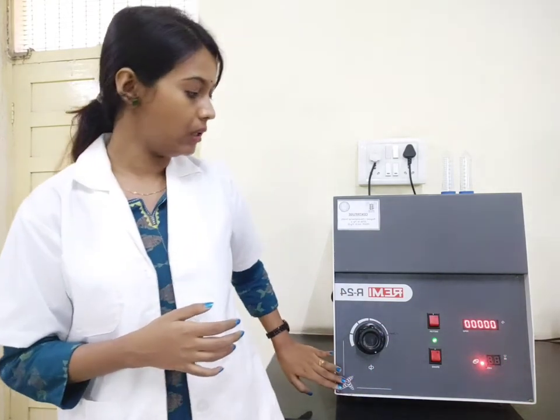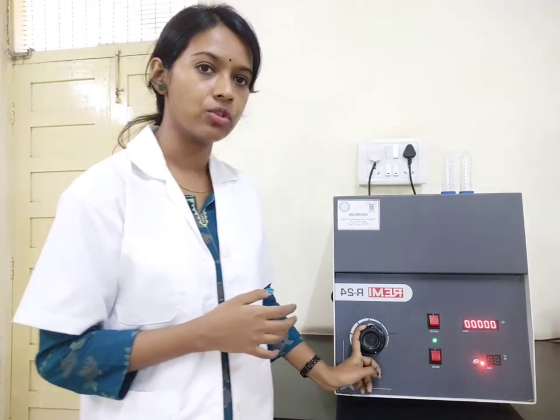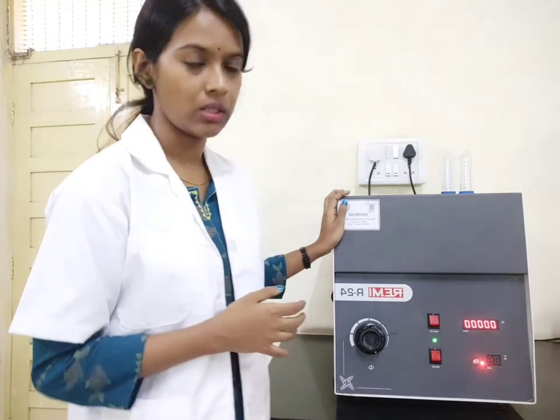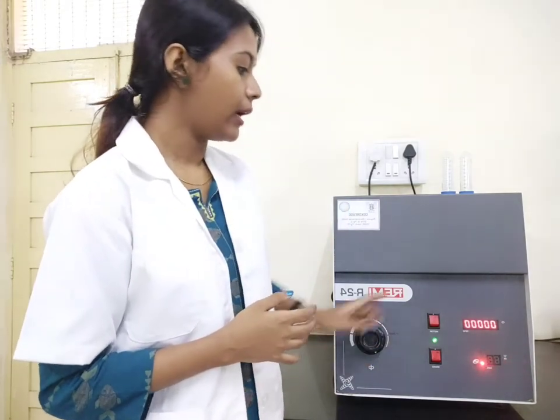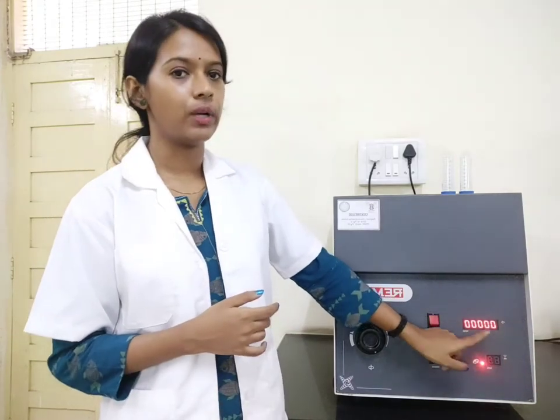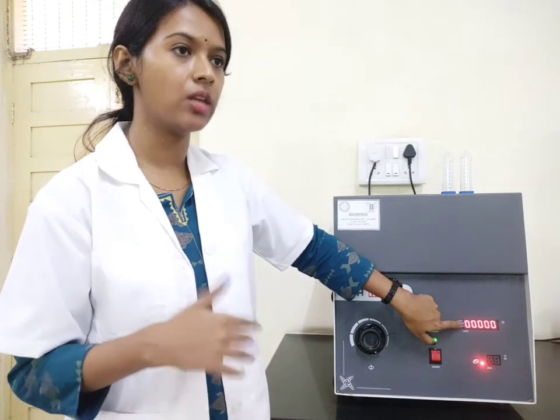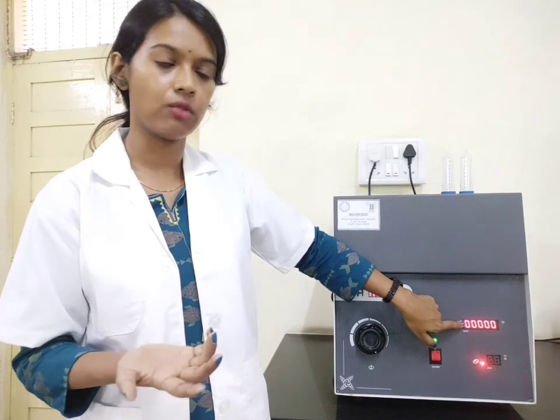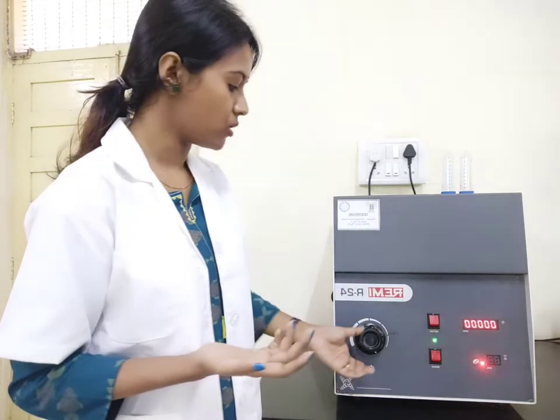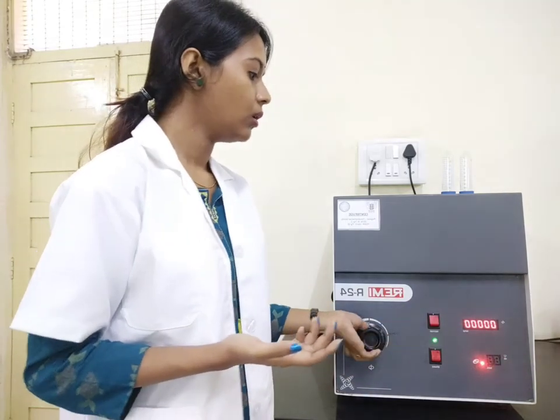Now, talking about the operation panel or control panel: you can see there is a regulator which is for speed. Since this centrifuge works at high speed, that is why you have a speed controller. There are two display units — the top one is for speed, meaning at what speed you want the centrifugation process to take place. Suppose you want centrifugation at 3000 rpm, 5000 rpm, or 8000 rpm — just by adjusting this regulator you can set the speed.